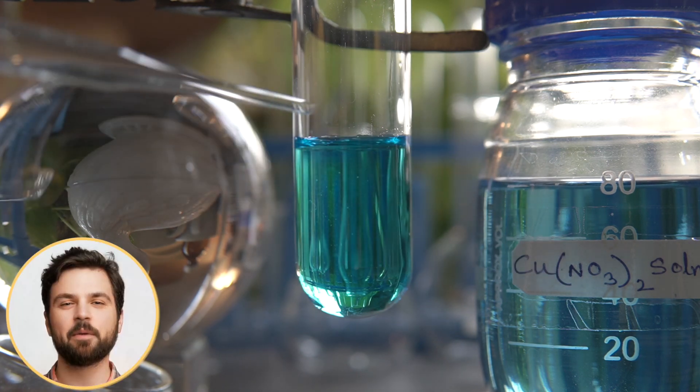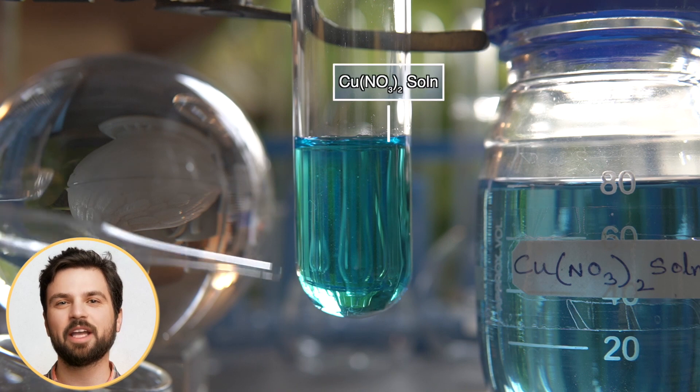Procedure: take some amount of blue colored copper nitrate solution into this test tube.